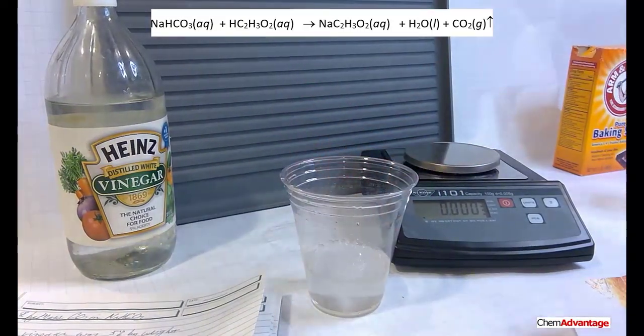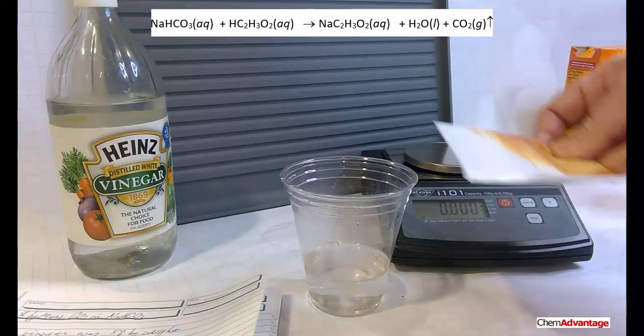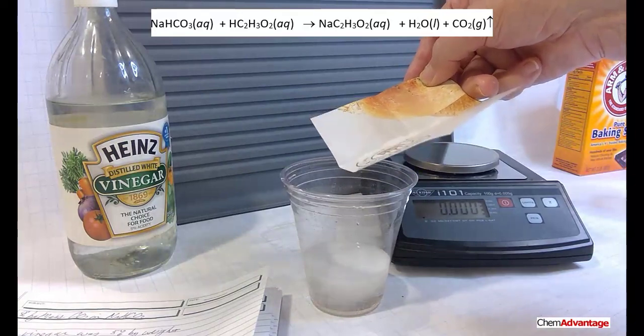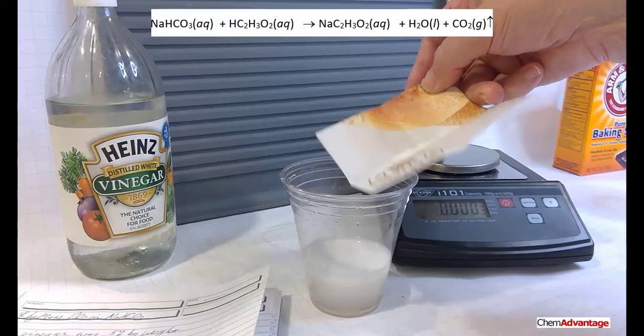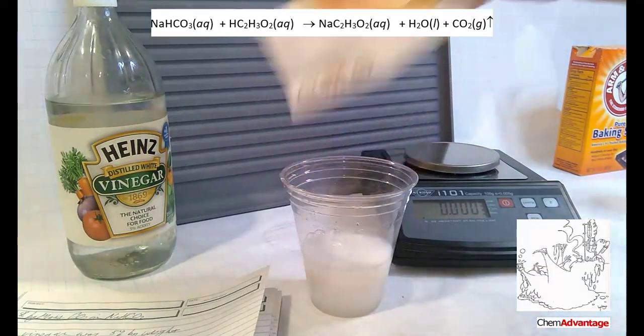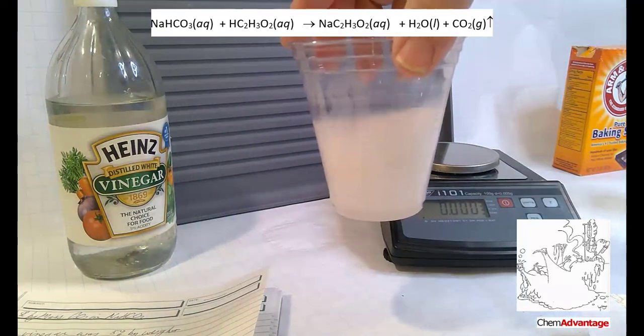There. And I don't want to lose any of those little grains. I think I can get the rest in okay. How brave do I feel? We're live. It's alive. Oh, excuse me. I'm having too much fun doing experiments.